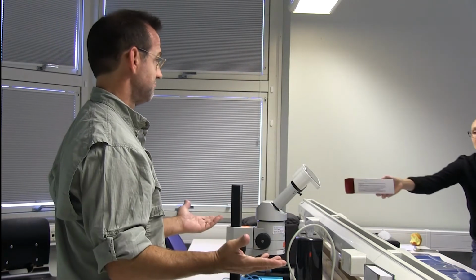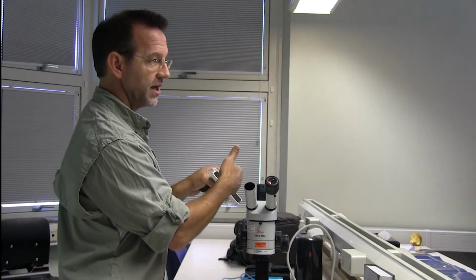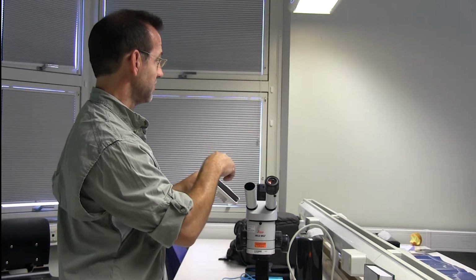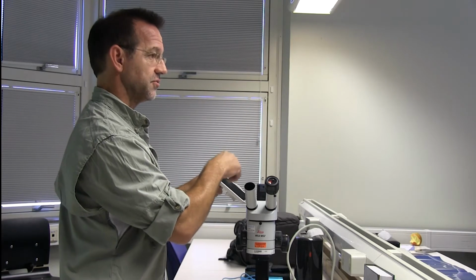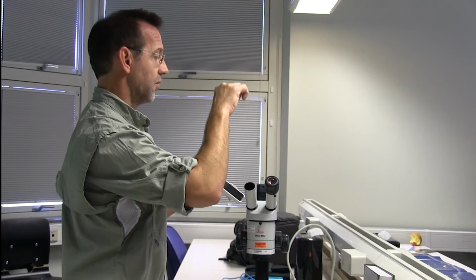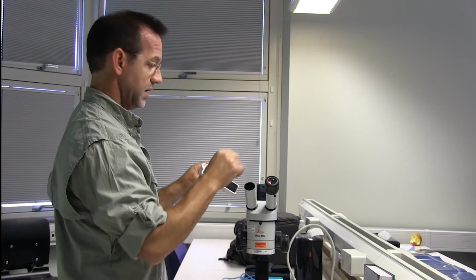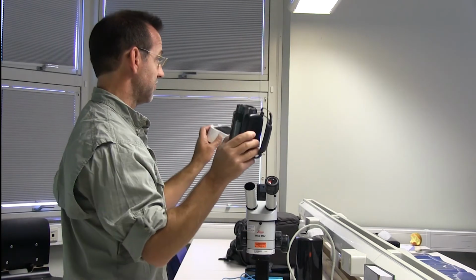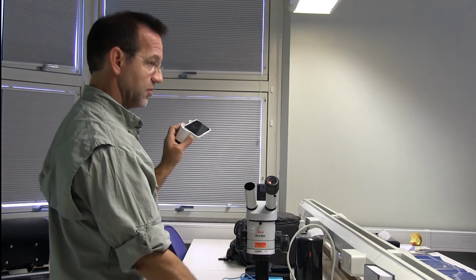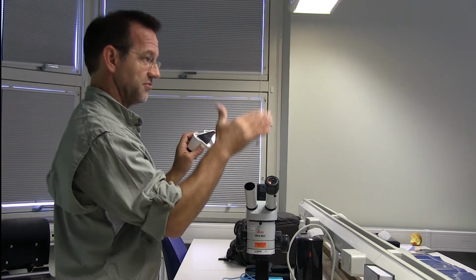So very simple one. But here's my recommendation. For example, the iPhone or Android camera is not as good as some of the camera apps that you can download. And so I typically use another camera app that's more adaptable, where you can change the lighting, or you can go to manual focus, because that's really important. If your camera, whether it's this one or this one, will only do autofocus, then every time you change the focus on the microscope, the camera's trying to adjust.